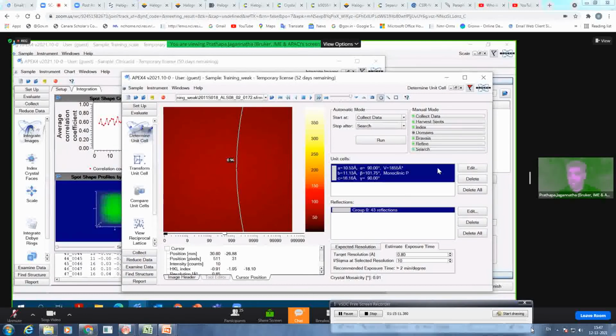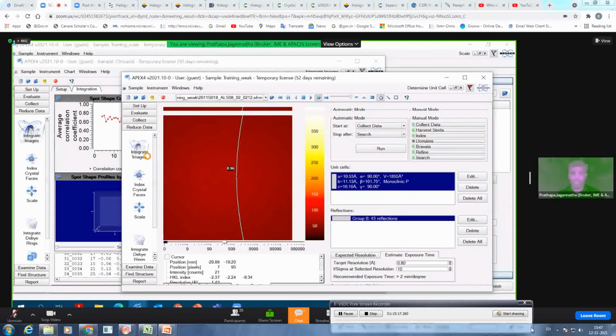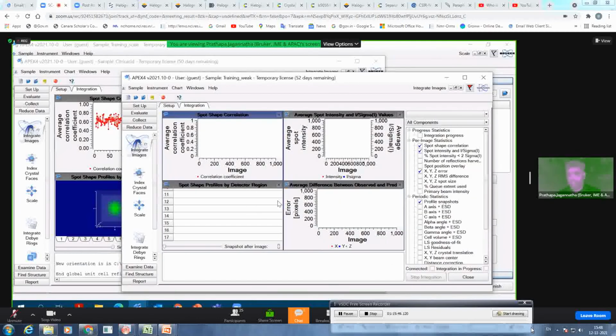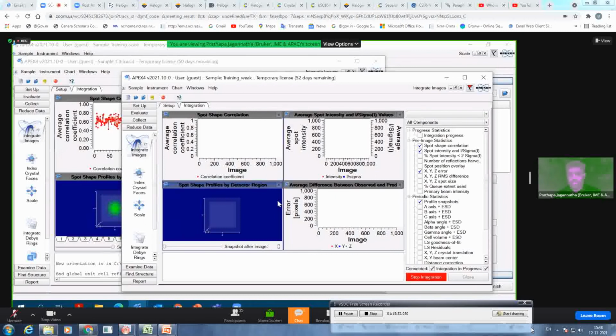For example, now I have just got some unit cell to save time. I just want to go to integrate images here, and I use just the default values. I don't change anything. I'm not going to tweak any parameters. I just want this to run without any modification, because I always do the initial integration without modifying any parameter. So I just want to start the integration. Hopefully it integrates. So let's have a look.